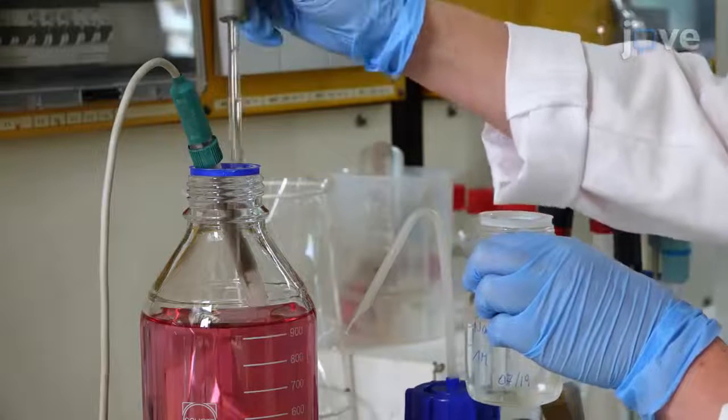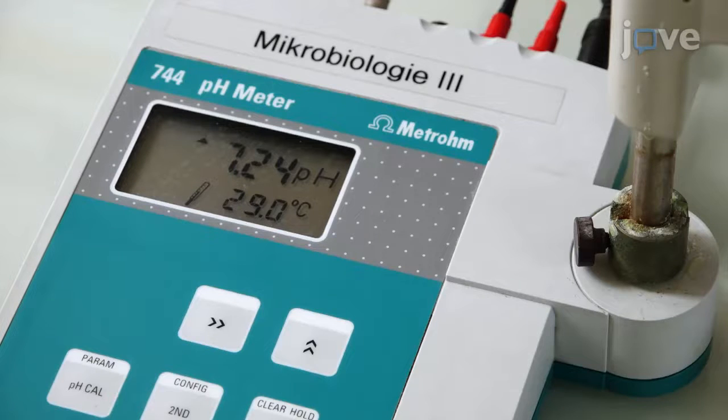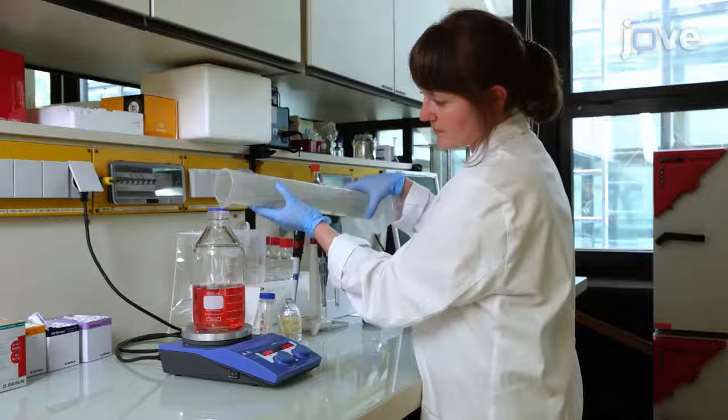Adjust the pH according to organism requirements and bring the final volume to 1 liter with distilled water.